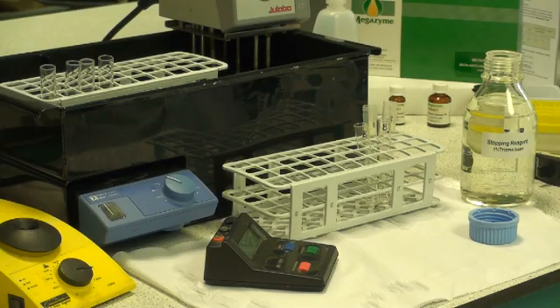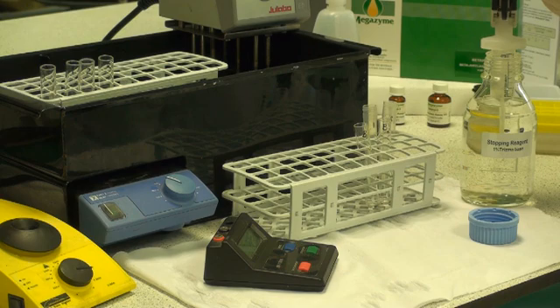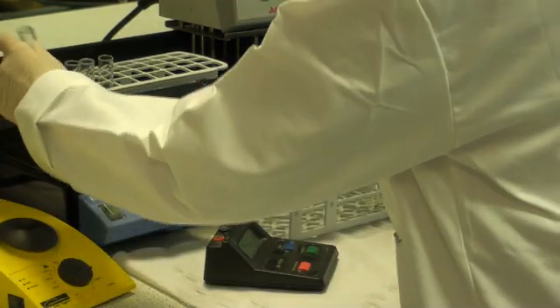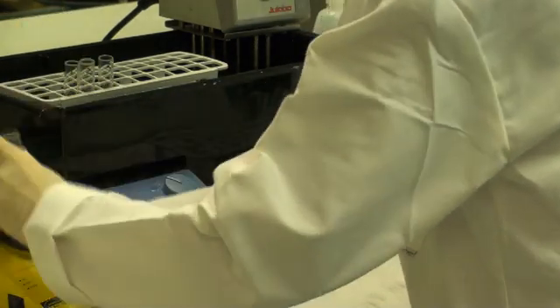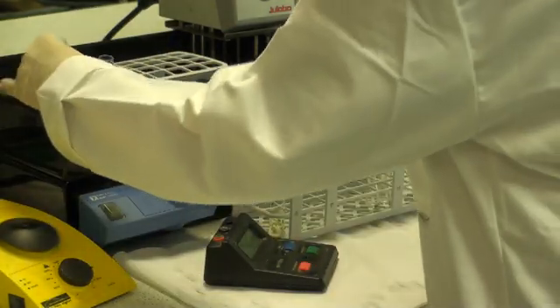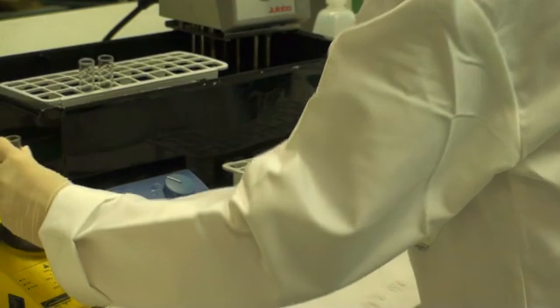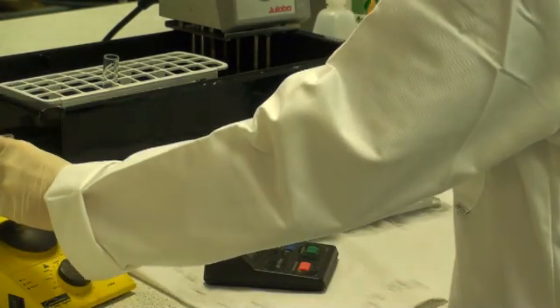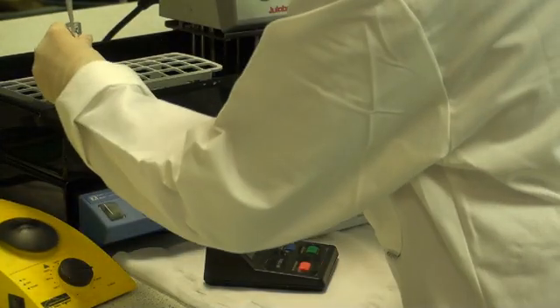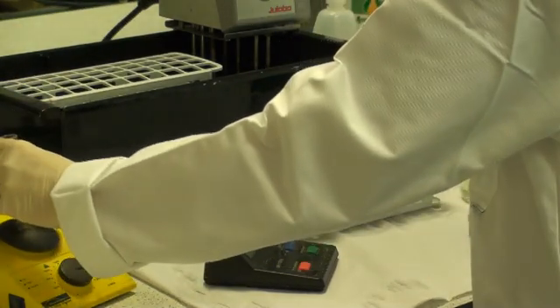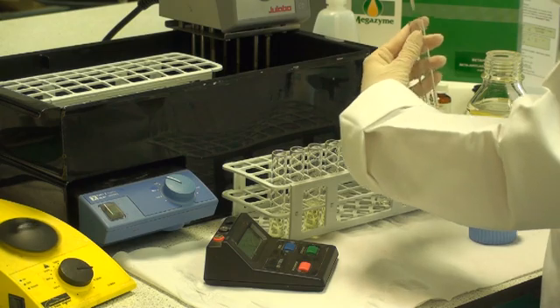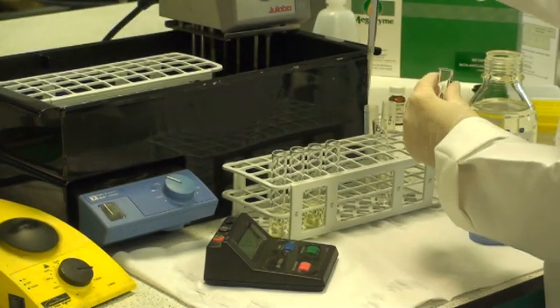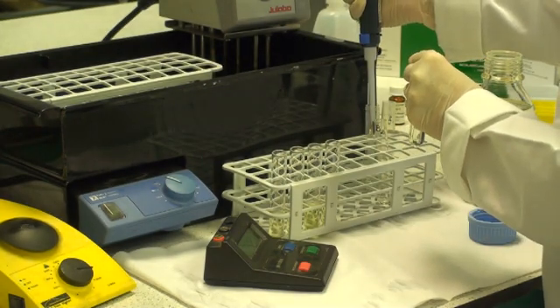At the end of the 10 minute incubation period, add 3ml of stopping reagent and stir the tube contents vigorously. Blanks are prepared by adding 3ml of stopping reagent, 0.2ml of the substrate solution, and this is then followed by 0.2ml of the enzyme extract.